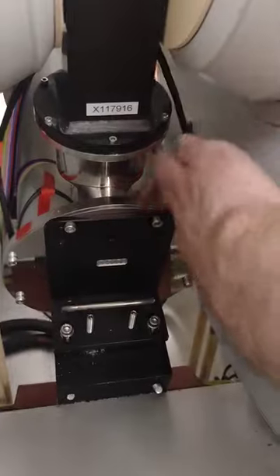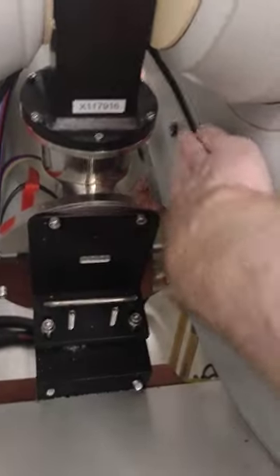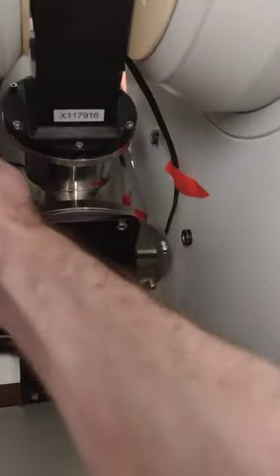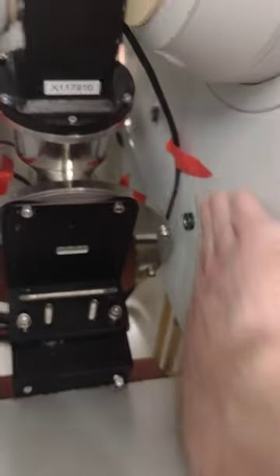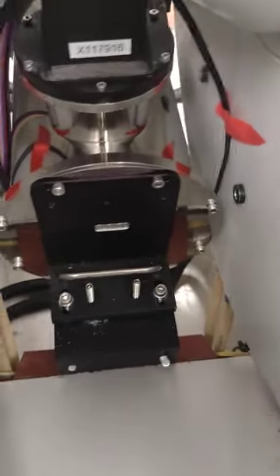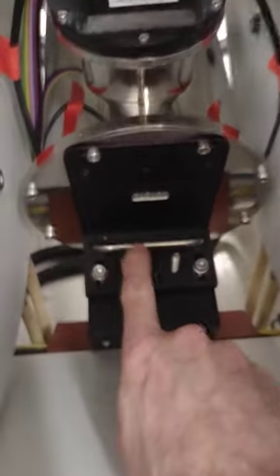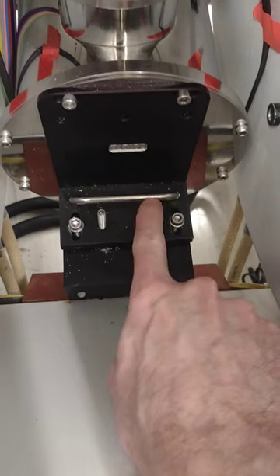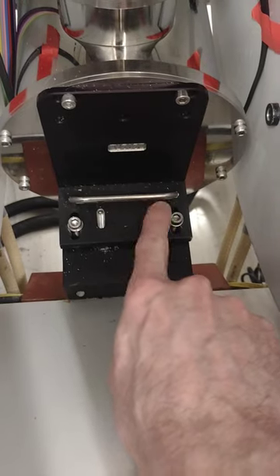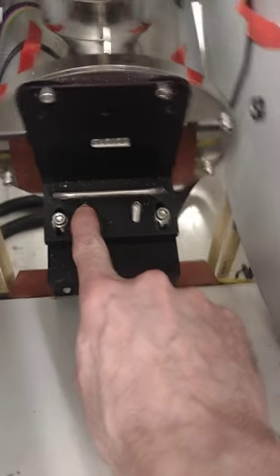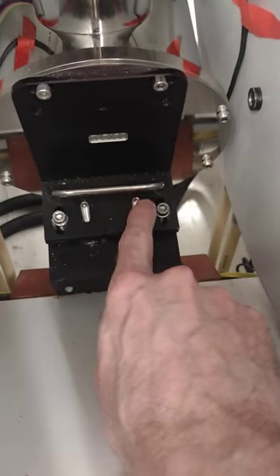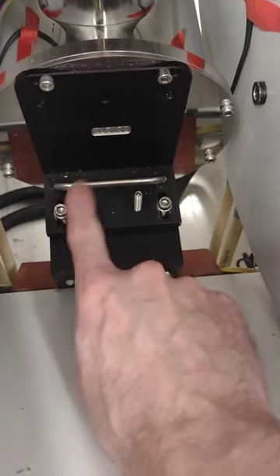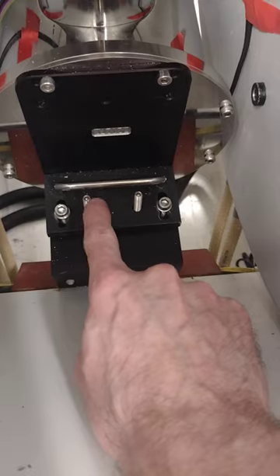Okay, the second thing you've got to loosen is down here. You notice I've got some tape on here, perfect way of keeping these wires out of the way. We've got these two bolts which have Allen key holes in them, but we never adjust those.